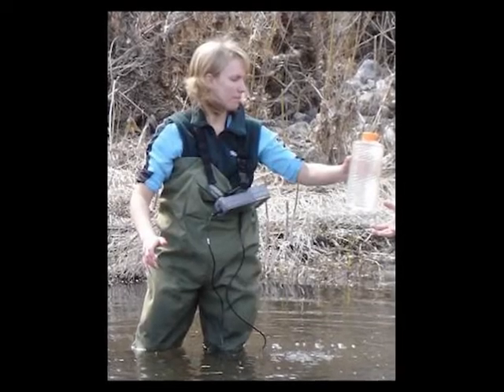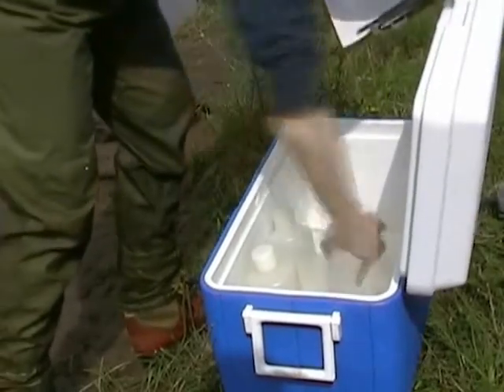But as you may have gathered, this method is time-consuming, labour-intensive, and of course fish die in the process. Also, PCR cannot quantify samples. We only learn whether C. shasta is present or absent, but not how much is in the river. So we wanted to develop a method that was faster and which would allow us to count parasites directly in the water. This involved figuring out how to collect and concentrate spores on a filter and developing a molecular test that would measure the amount of C. shasta present.